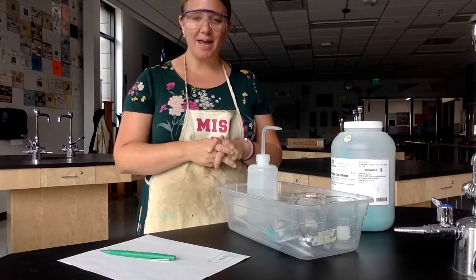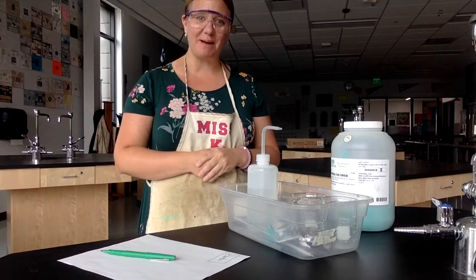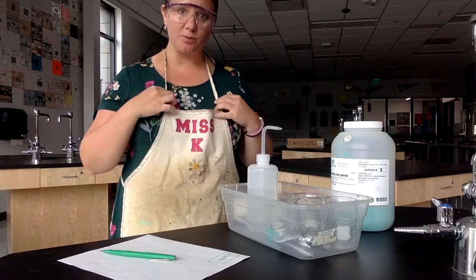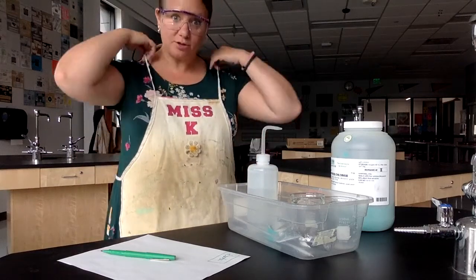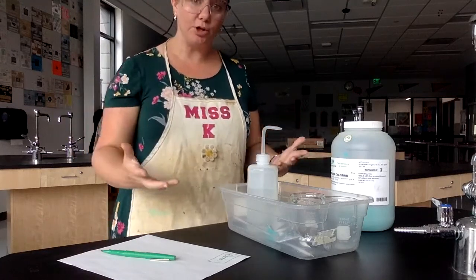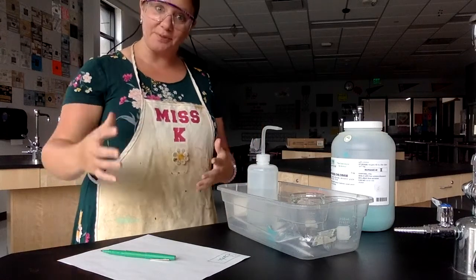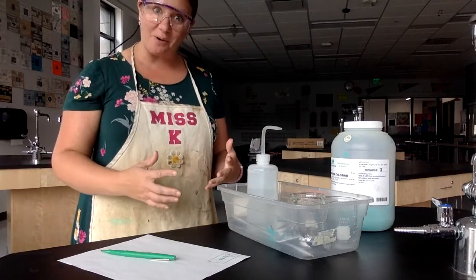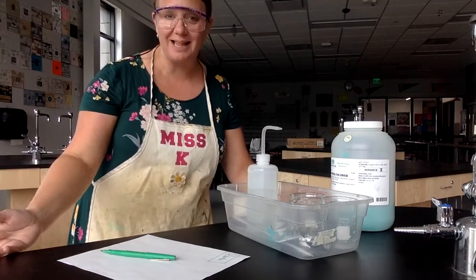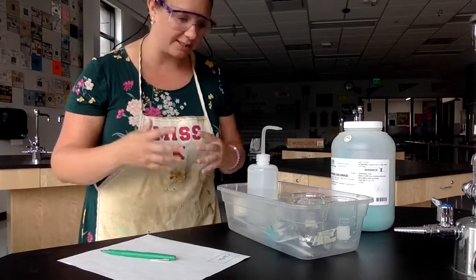Hey everybody, welcome to a chemistry video lab. Thanks so much for being my lab partner. What we're going to do today is demonstrate lab examples of physical and chemical changes. You're going to be able to see what's going on by watching the data and watching the lab — imagine you were standing here with me in class.